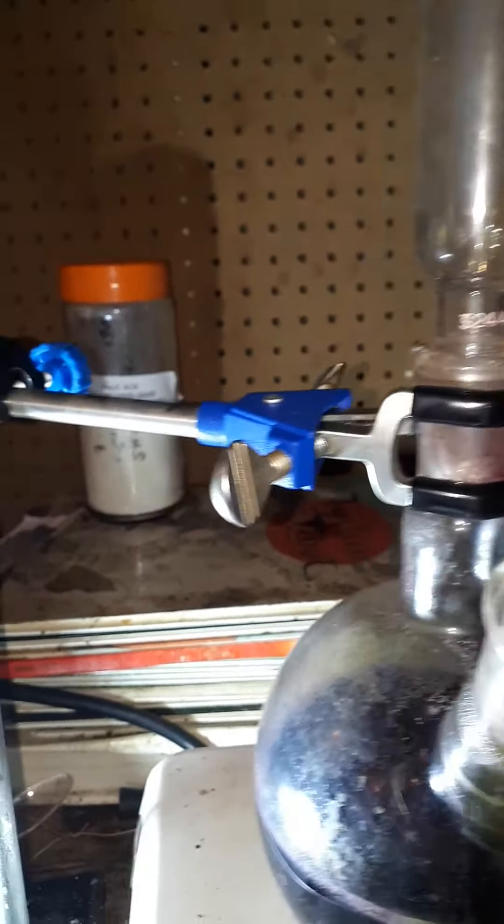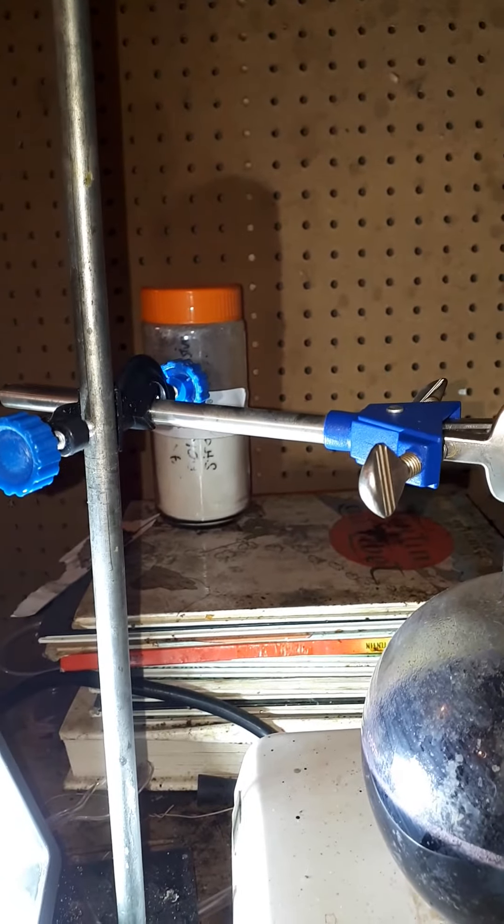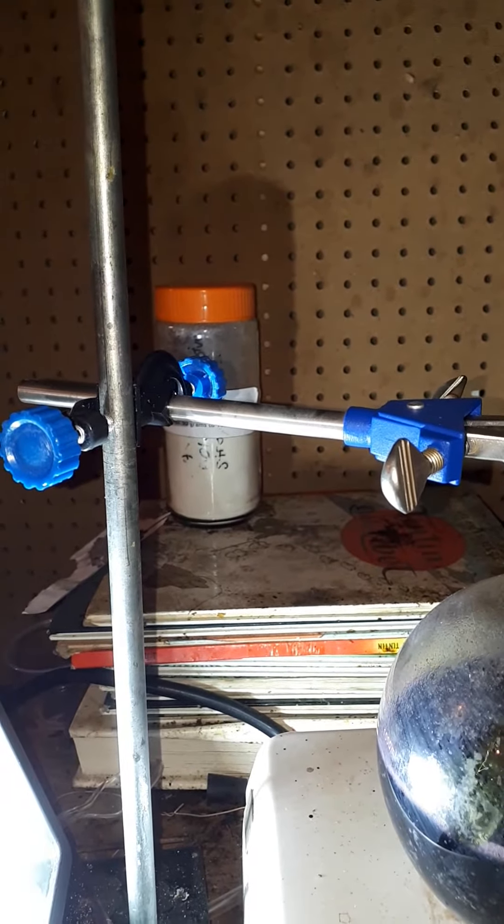I have this pipette and this piece of paper, and I can just go in here and draw out some solution once it's stirred, and we'll see what this does.